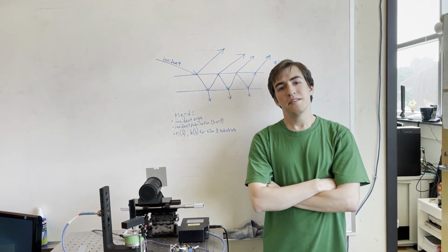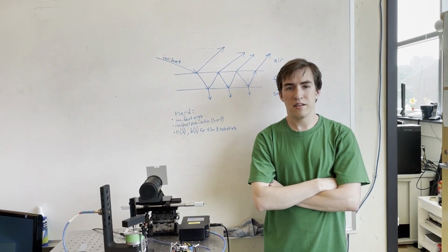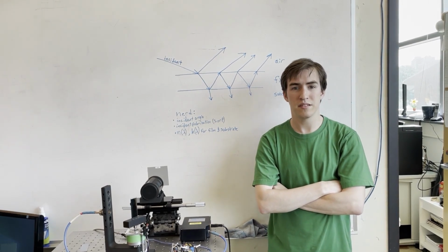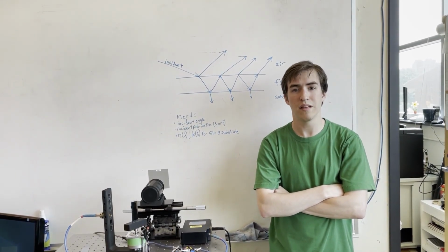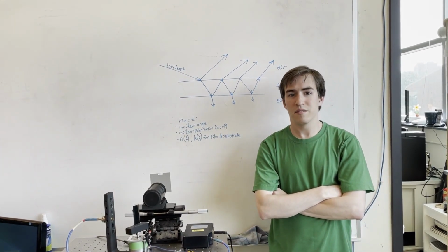Hi, this is the thin film measurement setup we've been working on this summer. The goal is to measure the thickness of a thin film deposited on a substrate. Such a measurement is possible because different wavelengths are reflected more or less than others. Measuring this change in the light spectrum allows for thickness to be calculated.